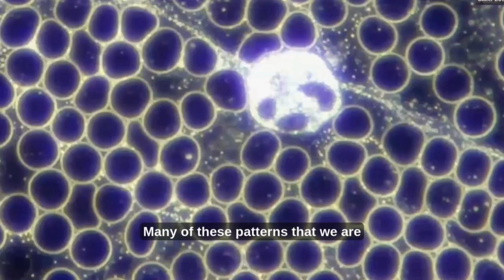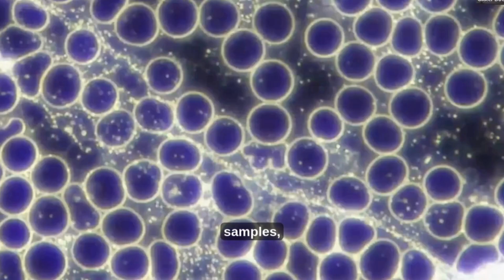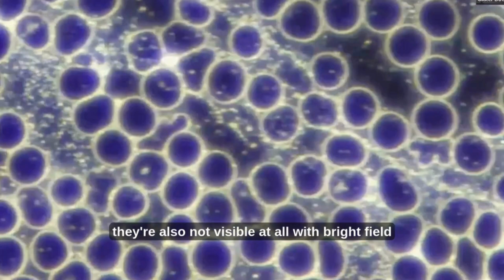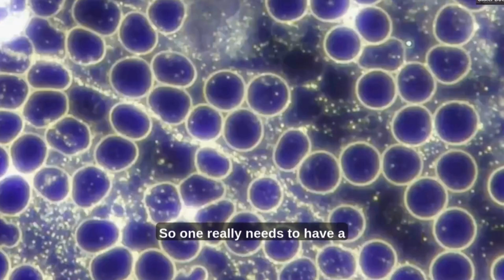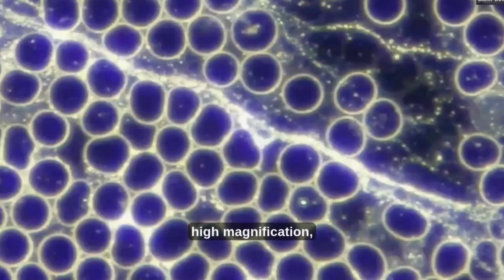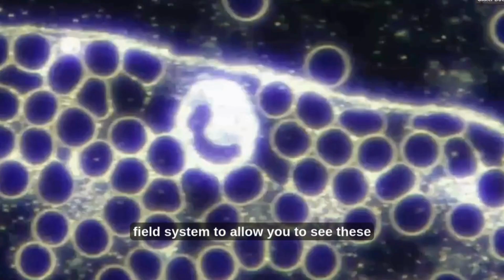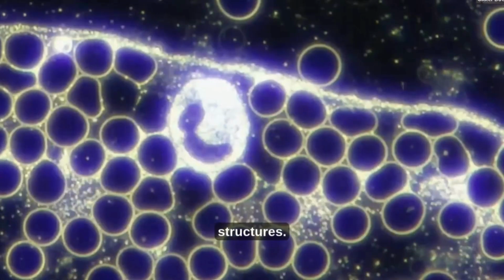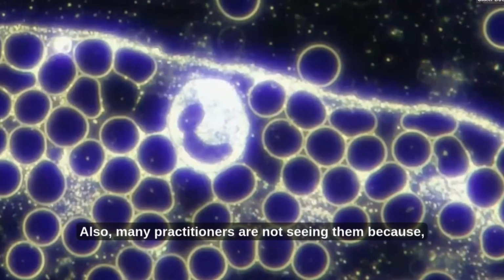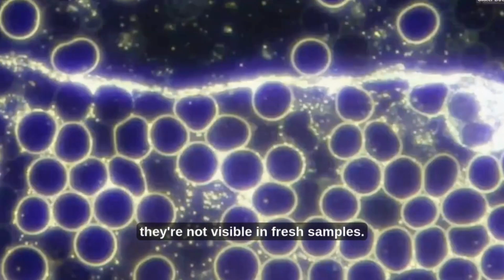Many of these patterns that we are seeing in these cases are not there in fresh samples. They're also not visible at all with bright field microscopy. So one really needs to have a high magnification, high contrast professional dark field system to allow you to see these structures. Also, many practitioners are not seeing them because, as I mentioned, they're not visible in fresh samples.